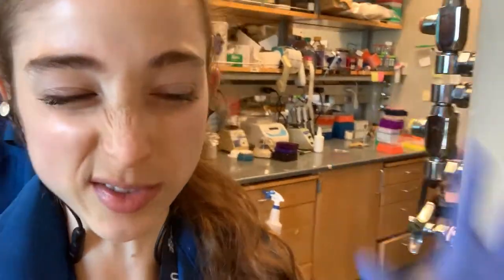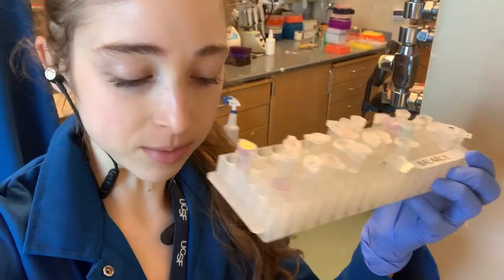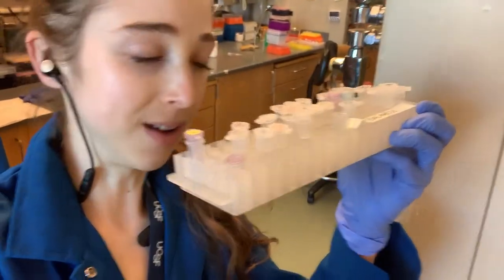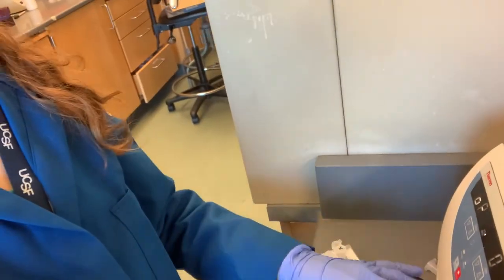If you're using a certain centrifuge and have permission to do so, you can make marks on the thirds to help keep track. I hate when you're doing mini preps or some sort of purification and you have a weird odd number of tubes that you can't use a simple trick for. Balance tubes come to the rescue — even if you're too lazy to figure out which combinations will balance. We often keep a rack of blank tubes with different amounts of liquid in them.